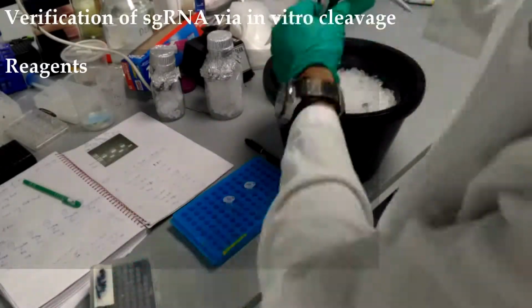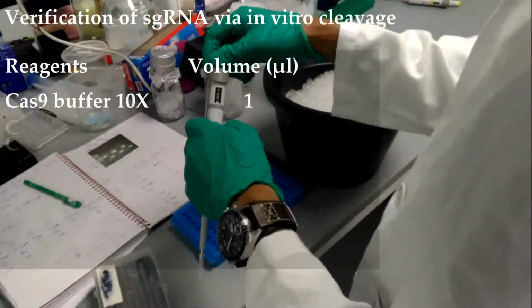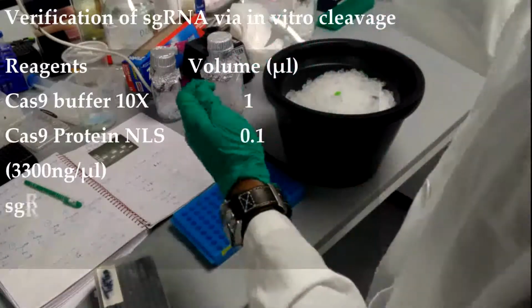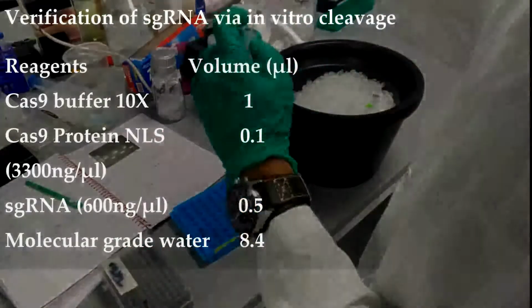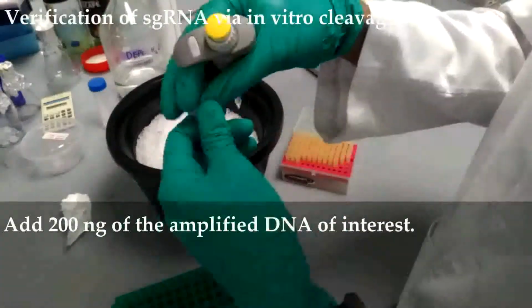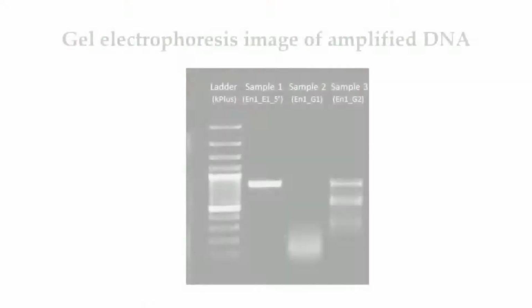Verification of sgRNA via in vitro cleavage assay. In a 1.5 ml microcentrifuge tube, add 1 microliter Cas9 buffer 10x, 0.1 microliter Cas9 protein, 0.5 microliter sgRNA, and 8.4 microliter molecular grade water. Incubate the sample at 37 degrees Celsius and leave it for 10 minutes. Add 200 nanogram of the amplified DNA. Incubate the sample at 37 degrees Celsius and leave it for 1 hour. Run the reaction in 1% agarose gel.